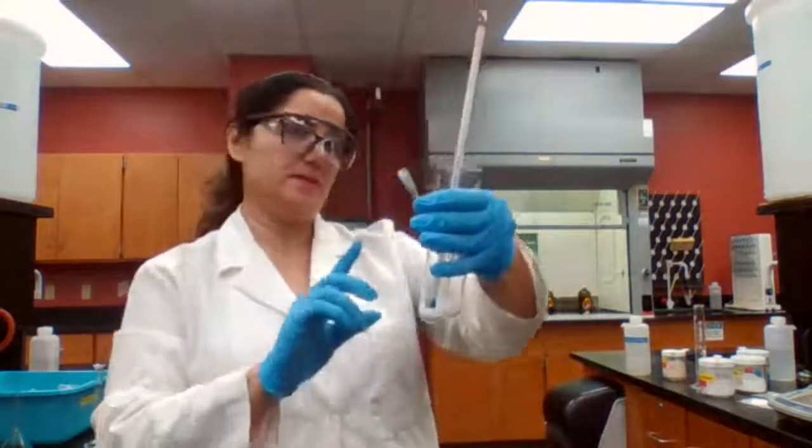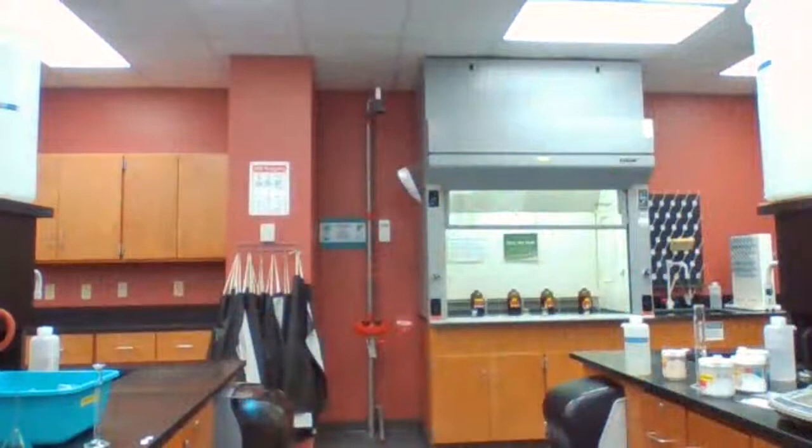I think using a second thermometer is better.